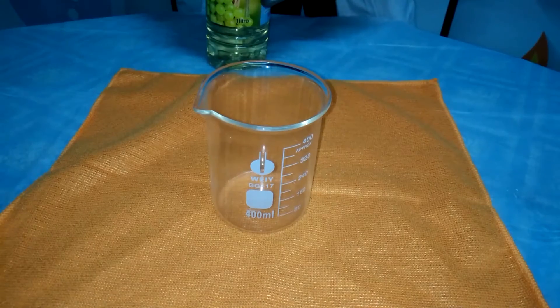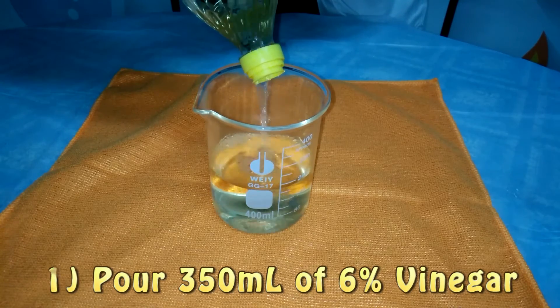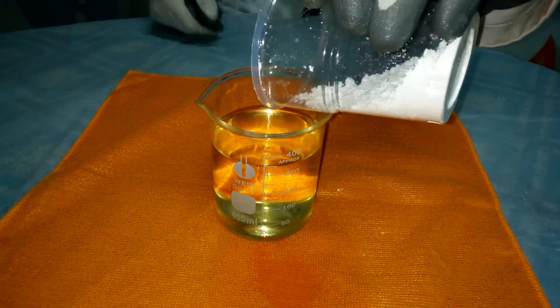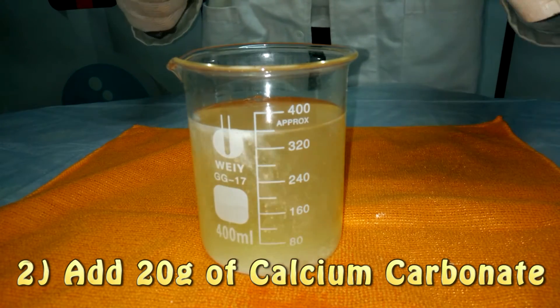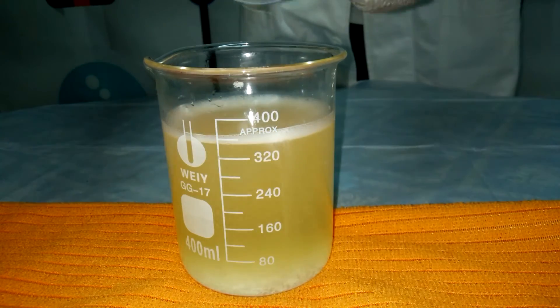Then we are going to put it in our oven because we want to eliminate all the remaining water. Because calcium acetate is soluble in water, we are going to heat it up, and later on we just have to dry our salt that forms.